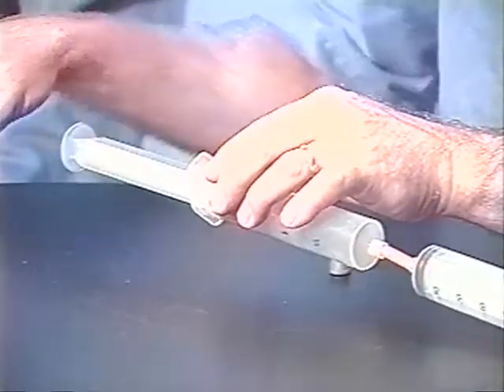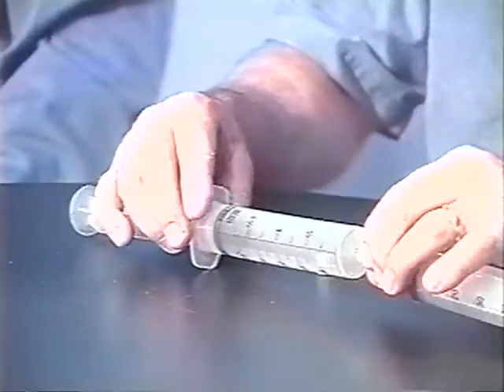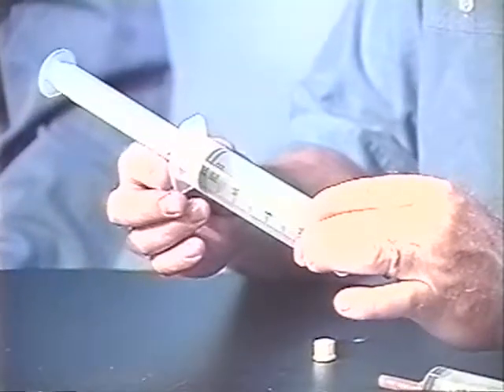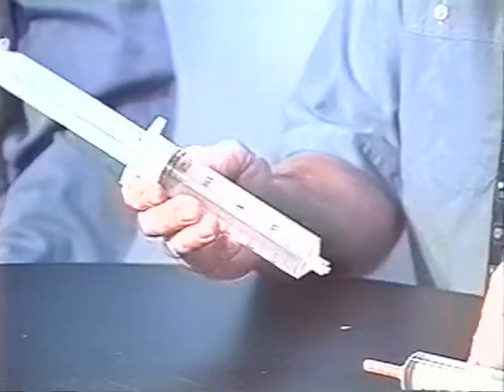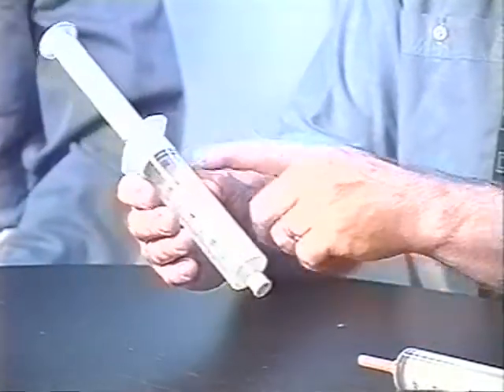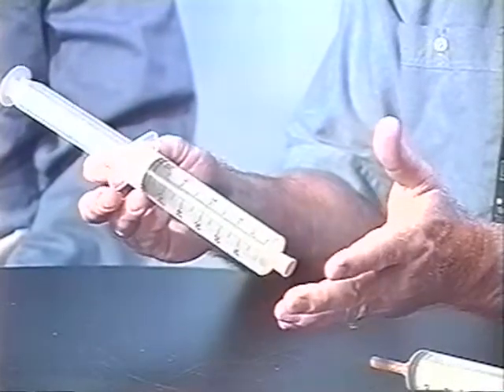The hole should be past the top of the syringe barrel. We'll insert the nail, disconnect the syringe itself, and then push the plunger in so that the nail is seated across the top of the syringe barrel. Put the cap back on — you must use the same cap that you weighed the first time, as these caps have various masses. Weigh this again on the analytical balance, and we've determined the mass of the gas present by subtracting the two.